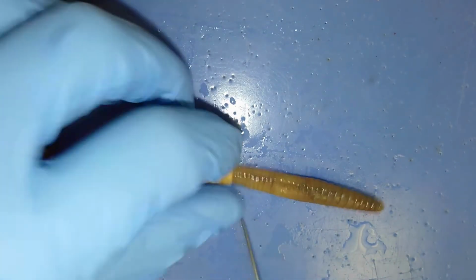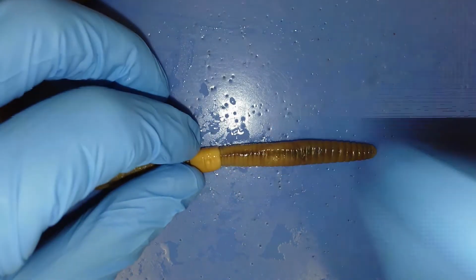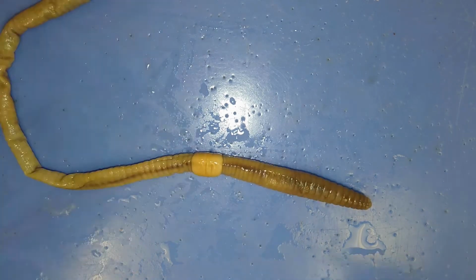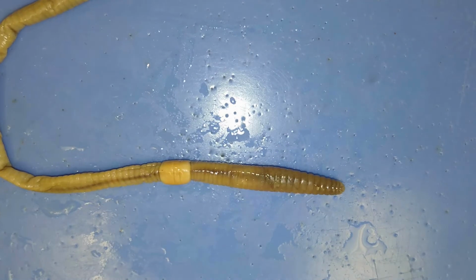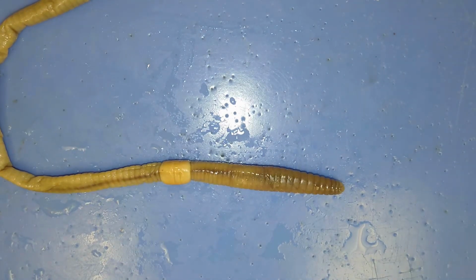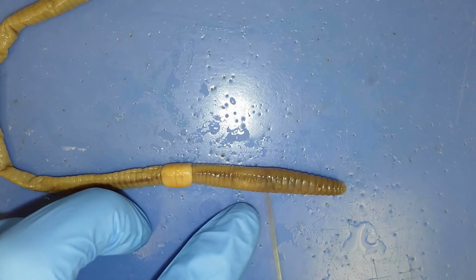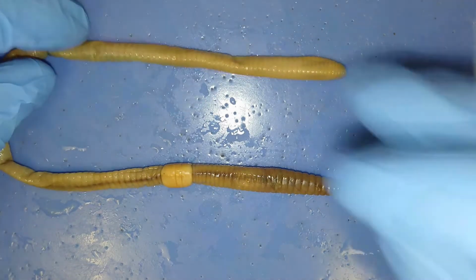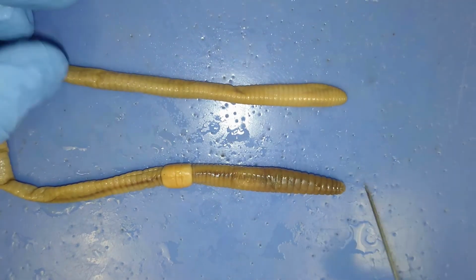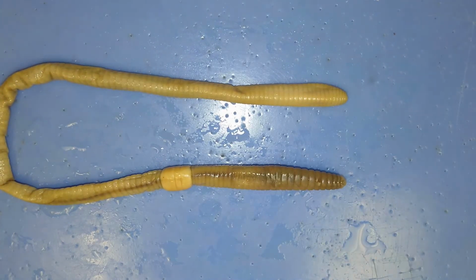So there is a dorsal and a ventral side. You just saw the ventral side right here. The dorsal side is much darker in color, so that's how we can tell which side's the top and bottom. So you can see each one of these structures is a segment. The Phylum Annelida is the first segmented organisms that we'll talk about this year. Other than that, there's really not much external anatomy. You just have to remember the prostomium, seminal receptacles, clitellum, anus, and segments.